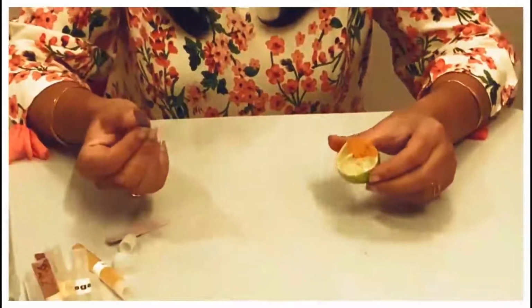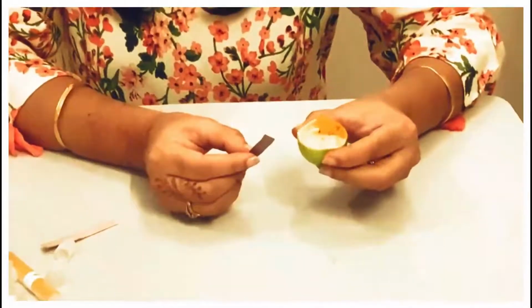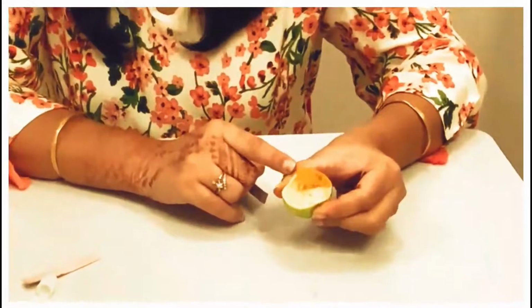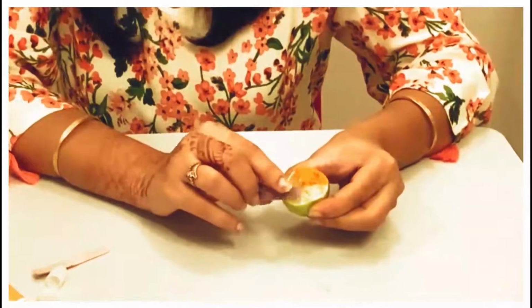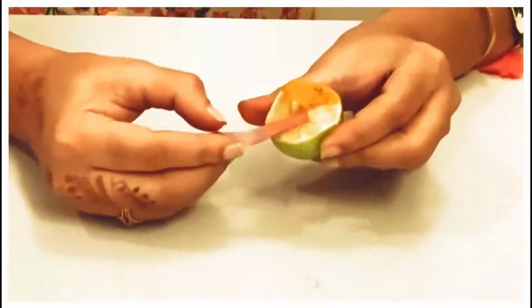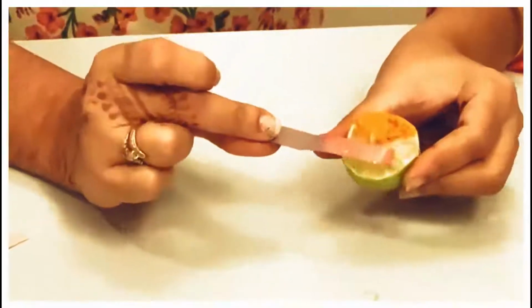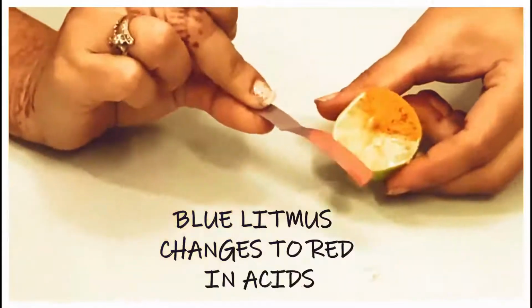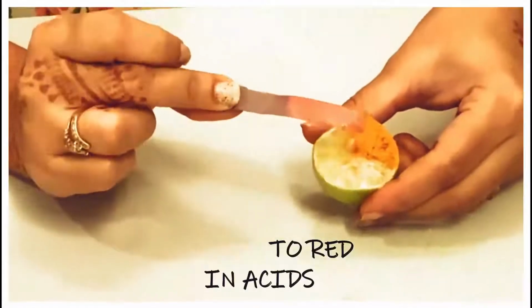Now let me take the other strip and test the same blue litmus paper with the citric acid, the same lemon which we tested with turmeric, and the turmeric had no change in the citric acid. But let me check about the litmus paper. You can see this litmus paper when dipped in the citric acid turns into red color. Can you see this? Beautiful red color. So blue litmus changed into red color.